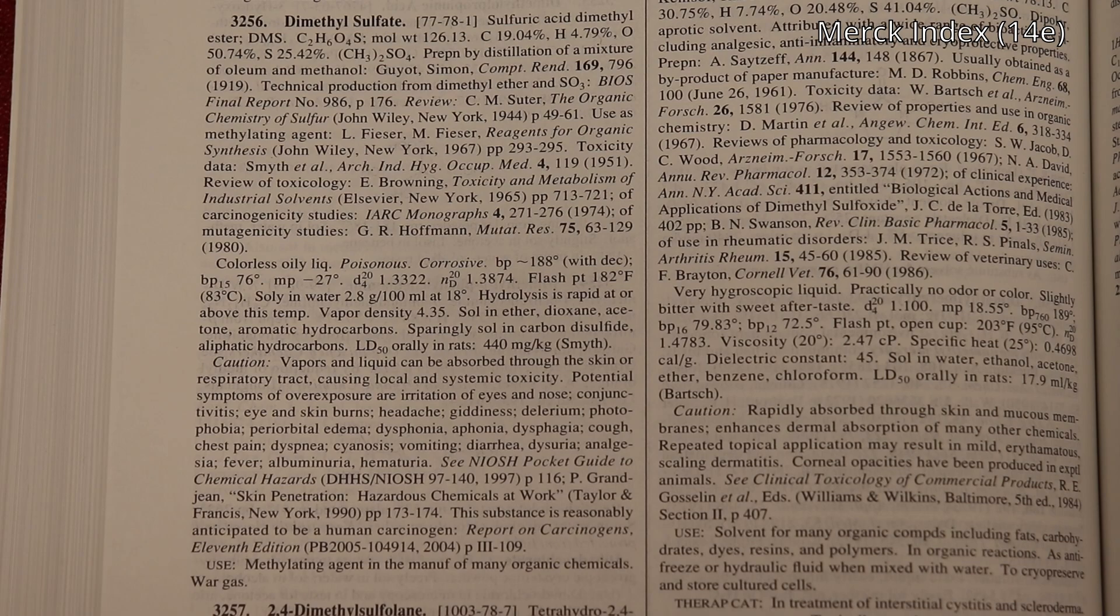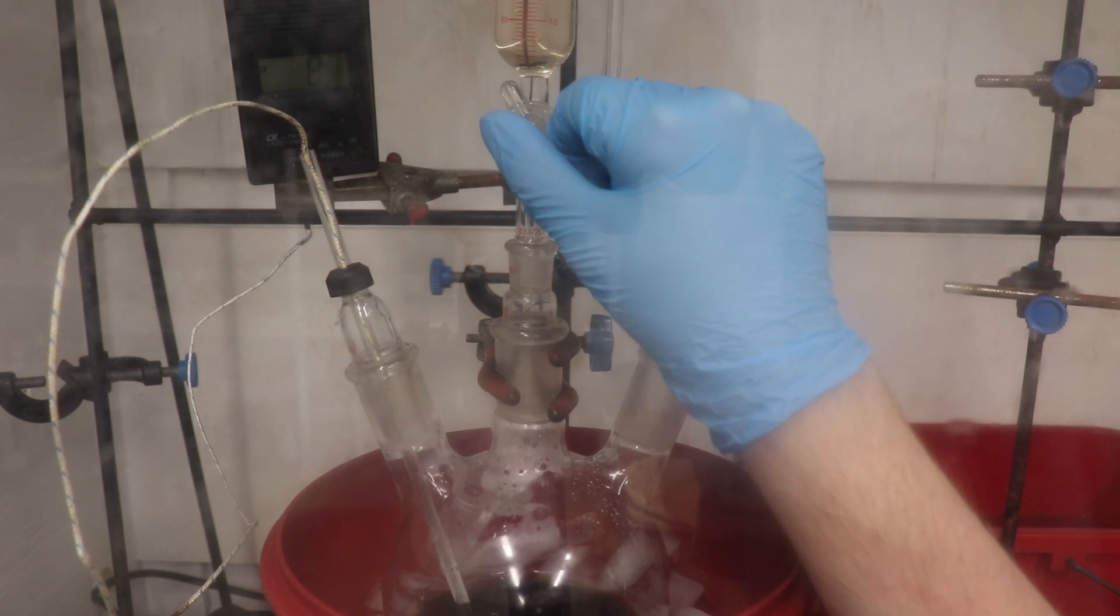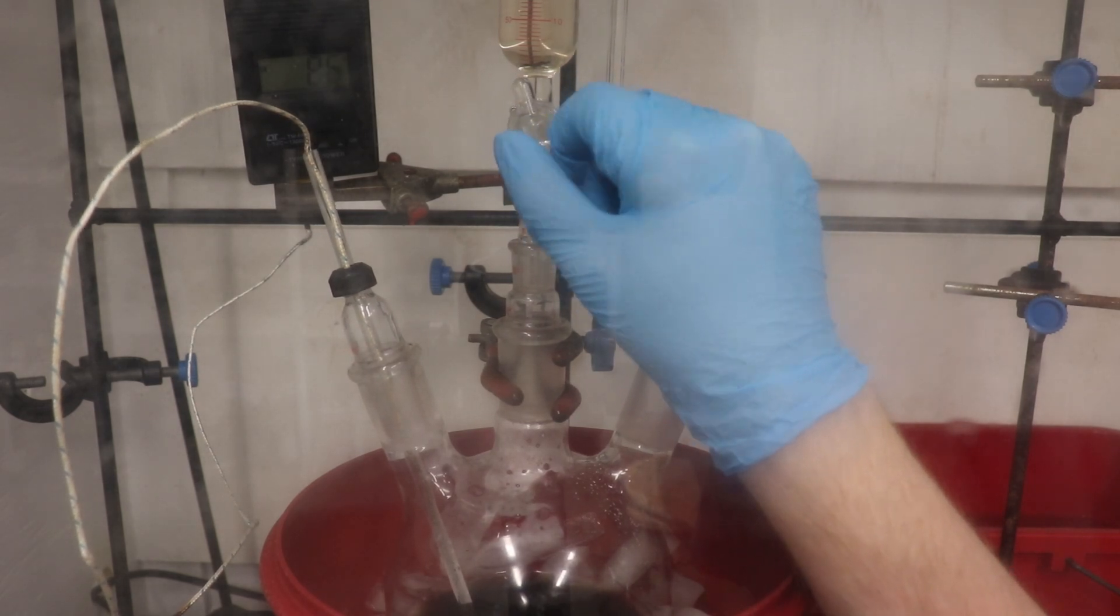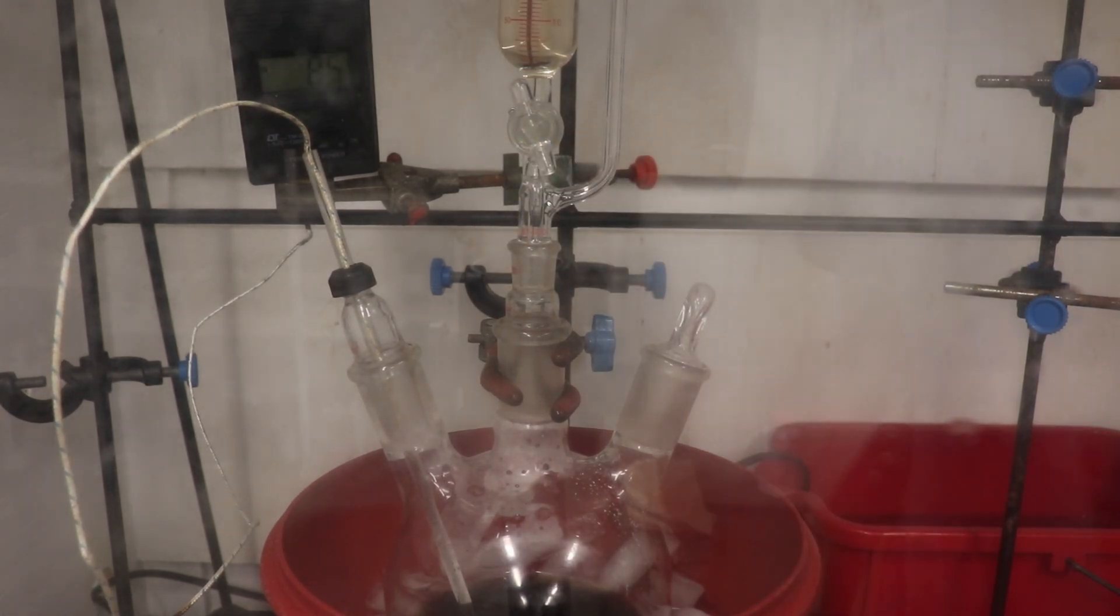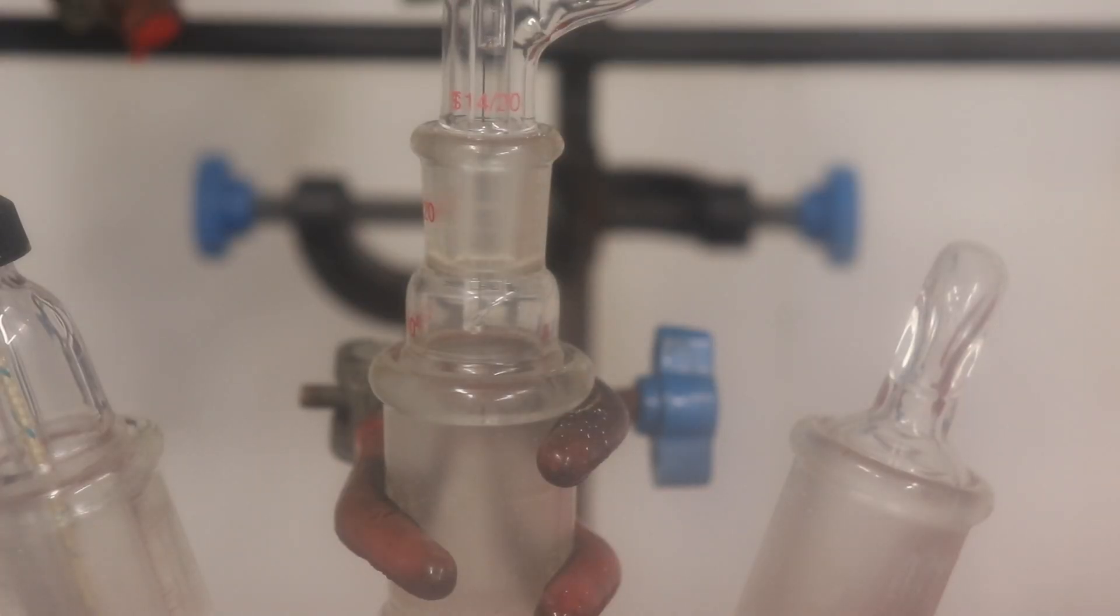The solution was cooled to 10 degrees Celsius in an ice bath, and then the dimethyl sulfate was added with strong stirring over the course of one hour.